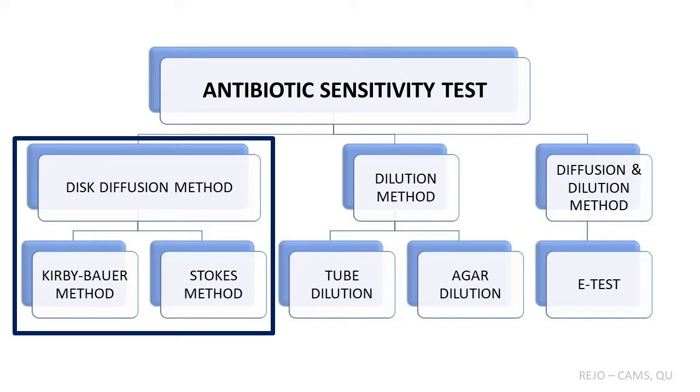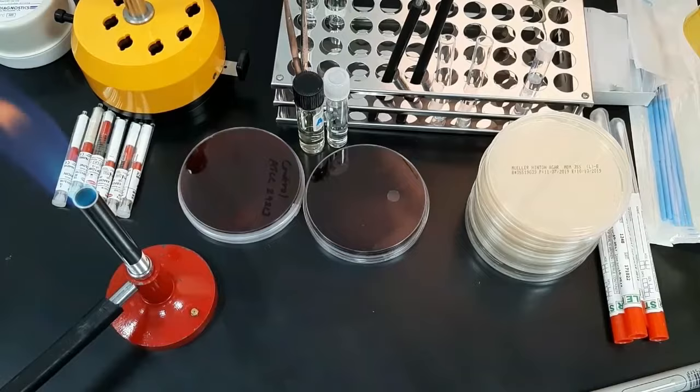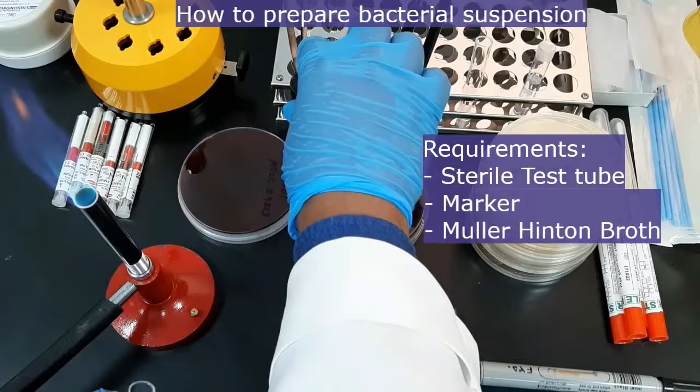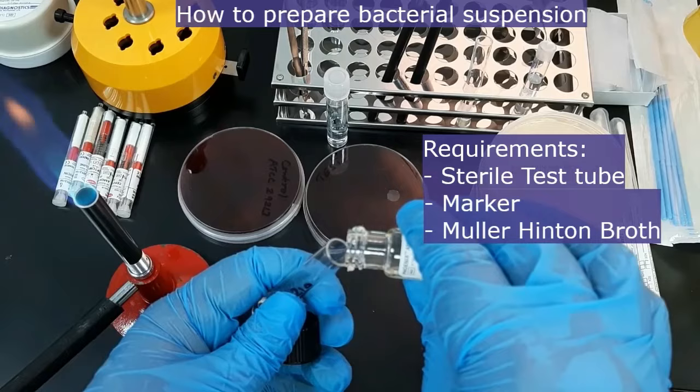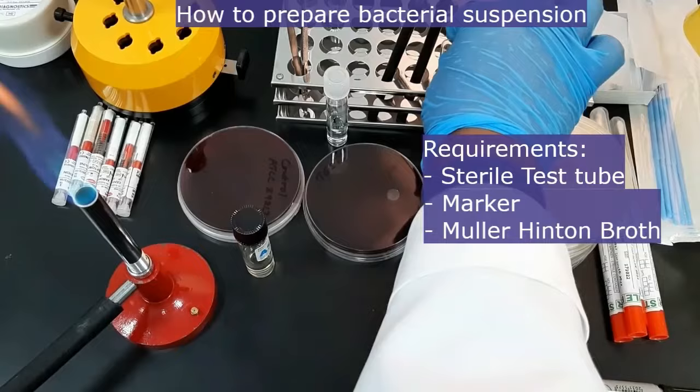Let's see what requirements are needed for the Kirby-Bauer method. First, you need to prepare a bacterial suspension from the pure culture. Pick up a sterile test tube, mark it with a number, and add 1 to 2 ml of Mueller-Hinton broth. You can also prepare the bacterial suspension in a given screw-cap AST bottle instead of transferring to a small test tube.